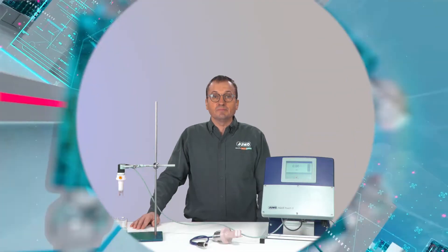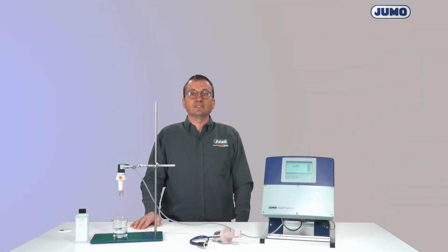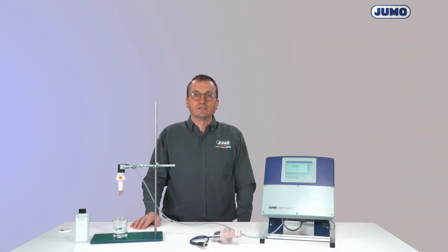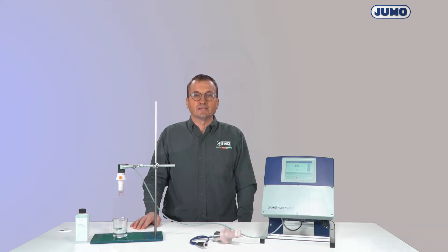If you want to calibrate electrolytic conductivity electrodes, then you've come to the right place. I am Manfred Schleicher, I work at JUMO and show you in this video how to calibrate the relative cell constant and the temperature coefficient safely.